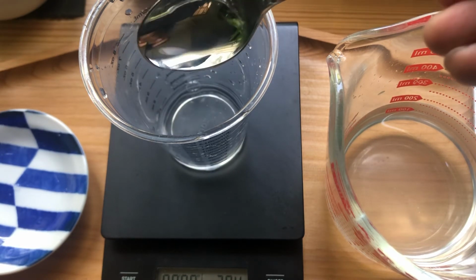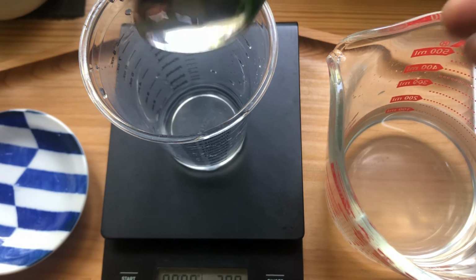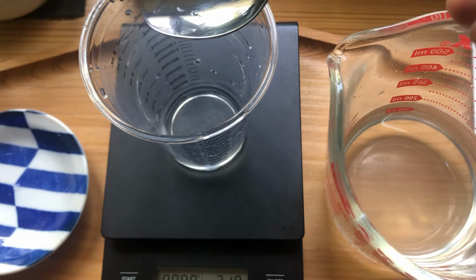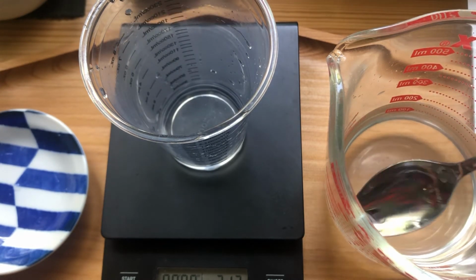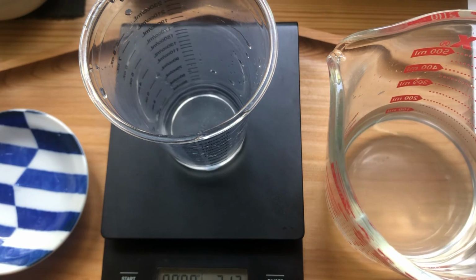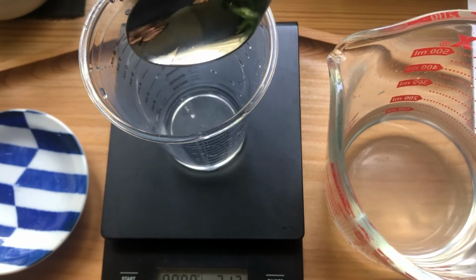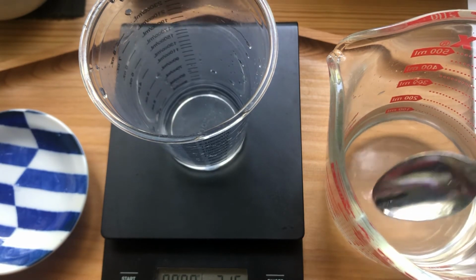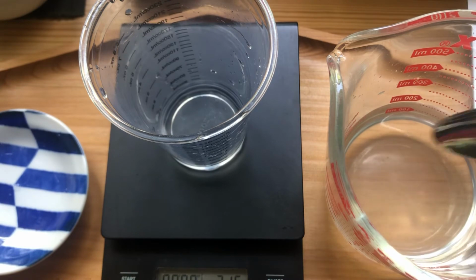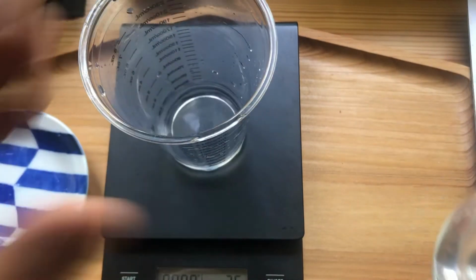I know. I say perfection is the enemy of getting things done. Wait, oh, what? Magic? I think some got absorbed on here. Oh, all of a sudden. Anyway, 21.6. That's pretty good. Do I mess with it? Oh, so yeah, there you go. Perfect. Okay, good. So this is my stock solution. There it is.